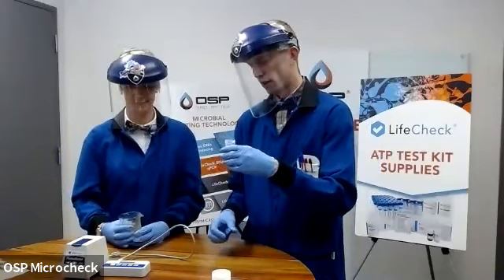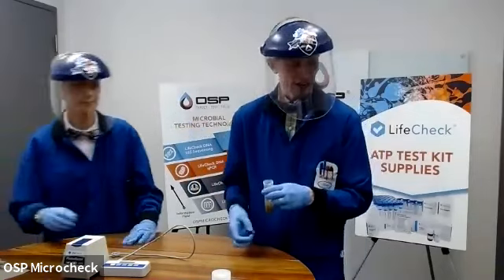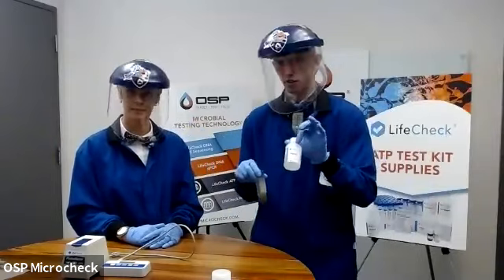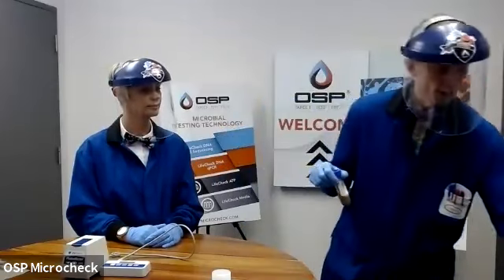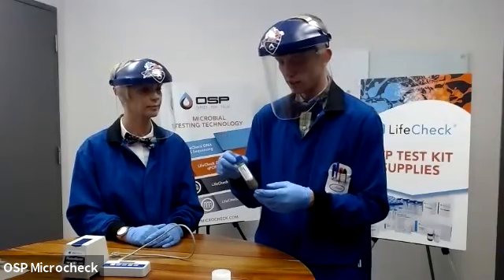So I wouldn't recommend going over 10 ml of your sample into this tube unless you add more reagent X, which remember, you do get reagent X in a larger bottle, so you are certainly within your means to do that. But really what I'm getting at is you don't want to over dilute your reagent X in the sample and then really harm its ability to lyse open cells.